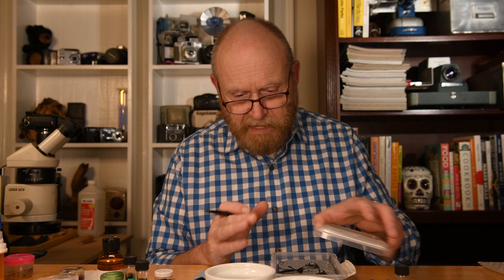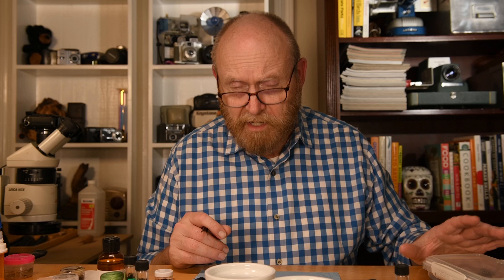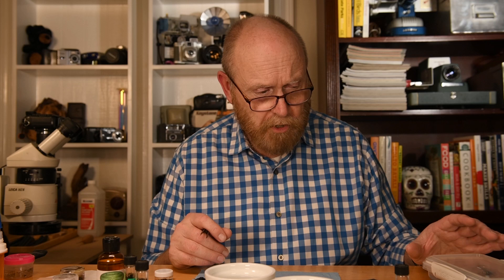Worse than rotting though is that they'll get mold growing on them, and once that happens they're pretty much lost. So I also put a couple of drops of phenol into the water — alcohol will do it, ethyl acetate will do it, acetone will do it. Just be careful what you put in here because it's a plastic dish and some of those solvents dissolve plastic. Once I've done that, I put the lid on and seal it tightly.